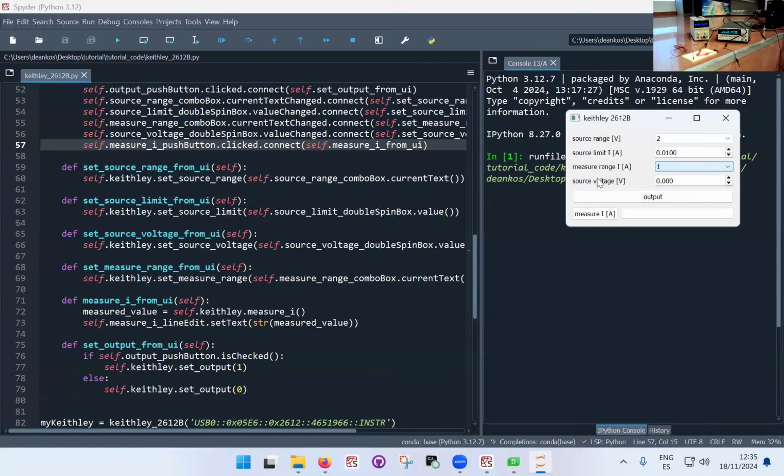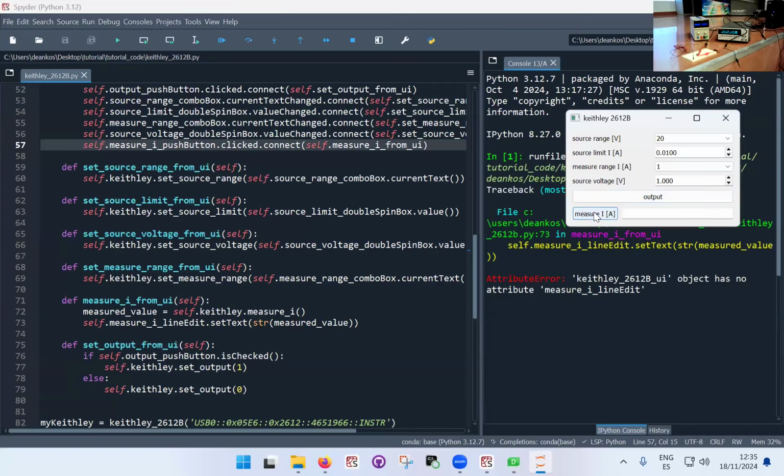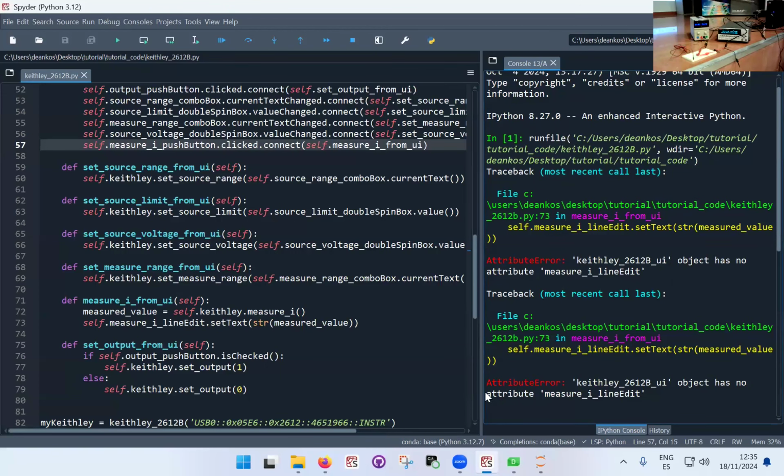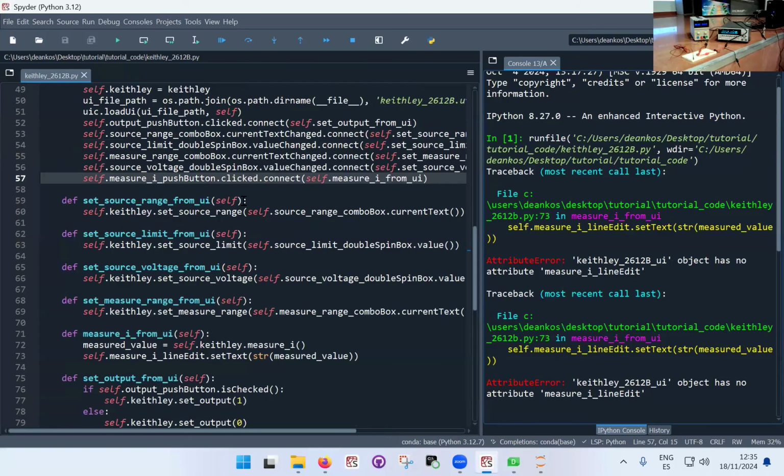So that is just changing things, and then we've got the source voltage. That should appear here at the bottom. That's channel A. So you see that changing in different voltages. The source range I can set to maybe 20 volts. That does the little change there. So I can set the source voltage to maybe 1 volt, for example, and then I can click output, and that's the output button. That also works. And I can measure. It doesn't do anything. Let's see. Clearly, right, I've probably forgotten something.